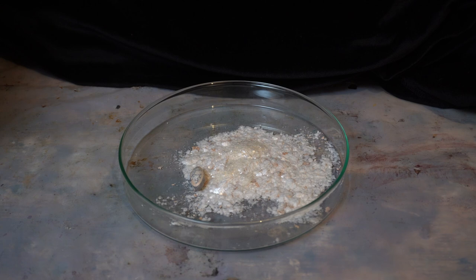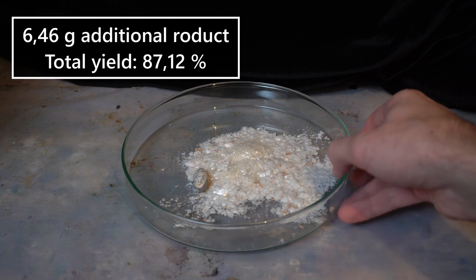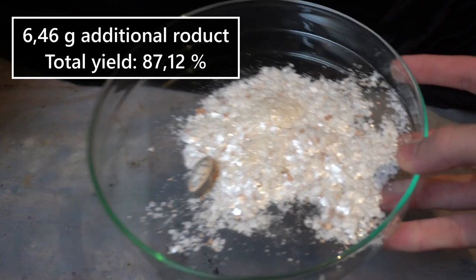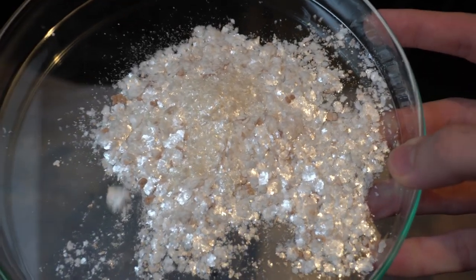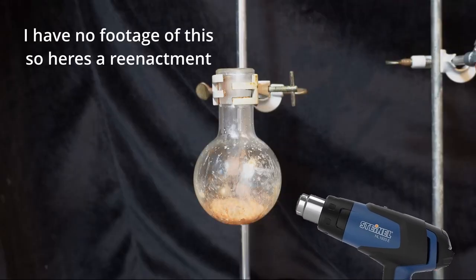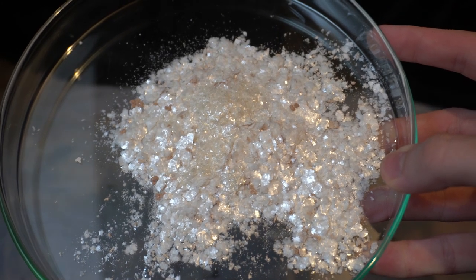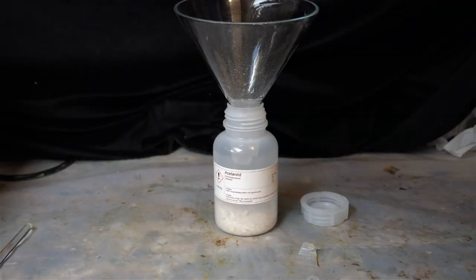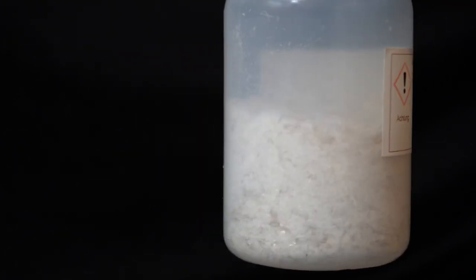We actually got a decent amount of additional product for all that work: 6.46 grams of acetanilide, which brings our total yield up to 87.12%. Now that's what I'm talking about. There is some brown gunk in there, which probably comes from overheating the crude compound with a heat gun while removing the DCM, but it's not very much so we can just ignore it. I won't combine this with the main batch and will instead process it immediately.